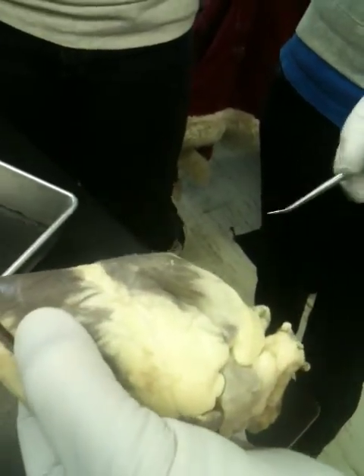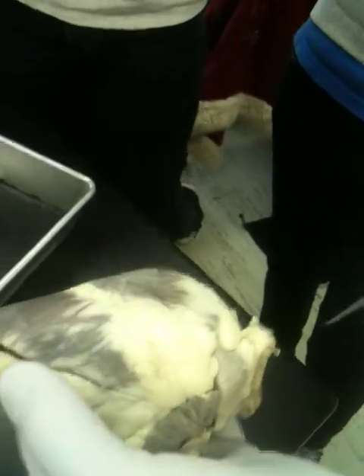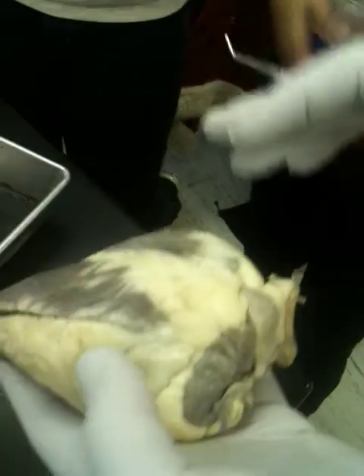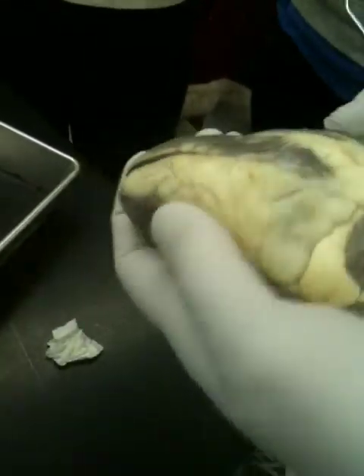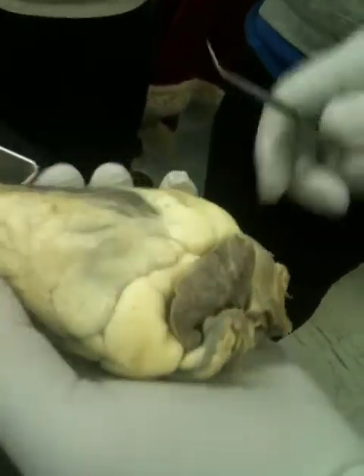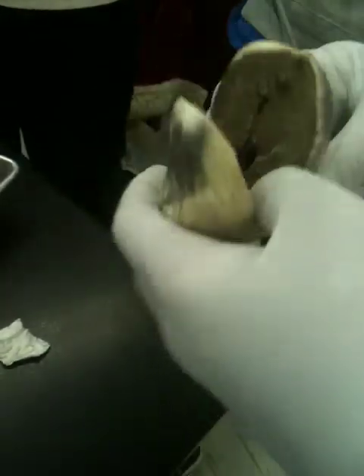What valley is this between the two ventricles? Anterior interventricular sulcus. Yep. You won't be able to look at your list on the test, so make sure you can recall these names and write them out. What little valley is right in there like that? Coronary sulcus. I think that's everything on the outside that I asked you to know. So let's go inside.